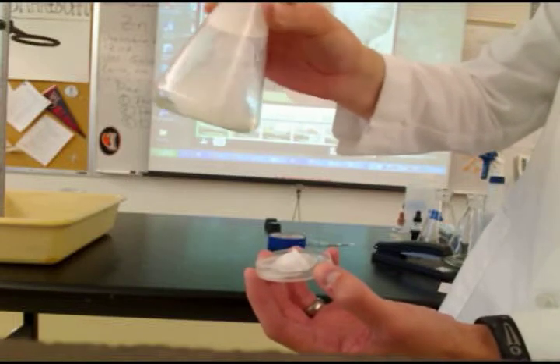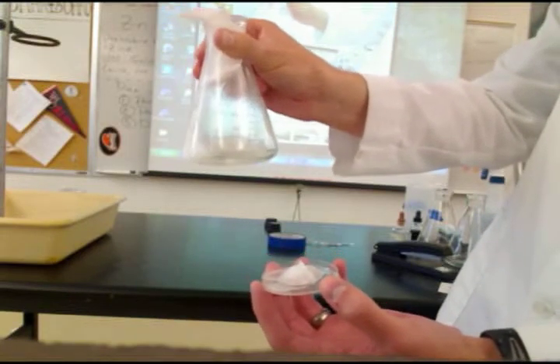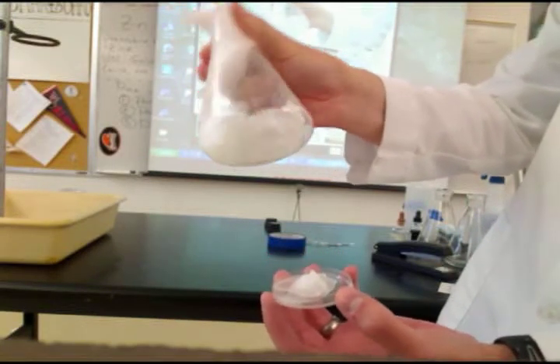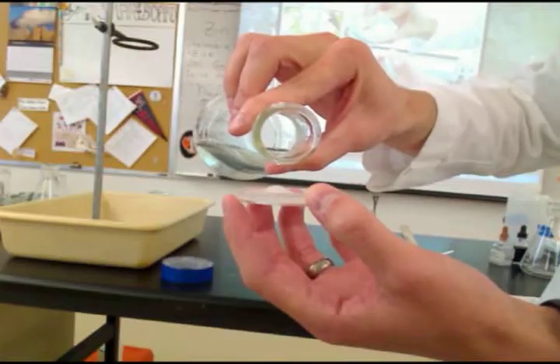Nice. Whoa. That's sweet. May I ask what kind of liquid that is? Yes, it's sodium acetate trihydrate. Would it have to do with something when it touches the oxygen or something? Nope.